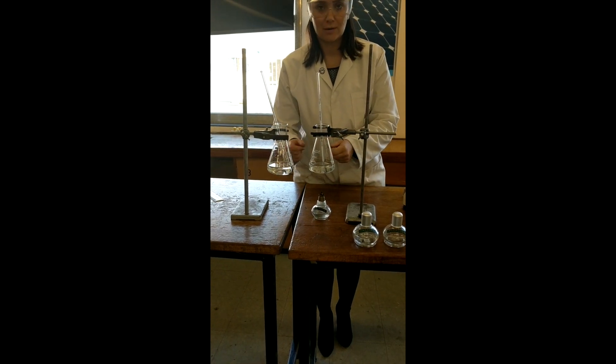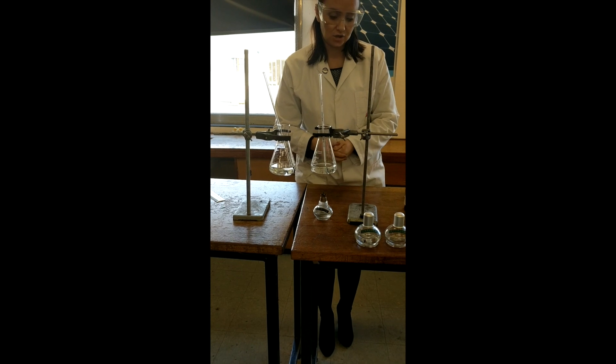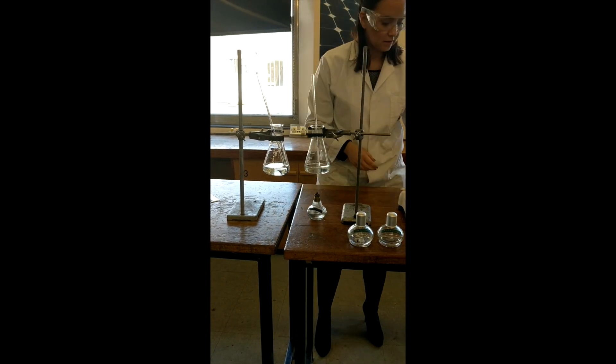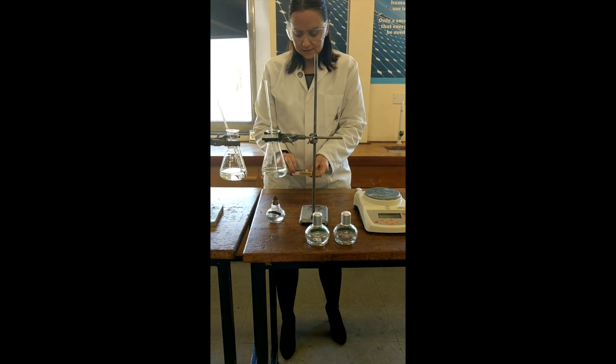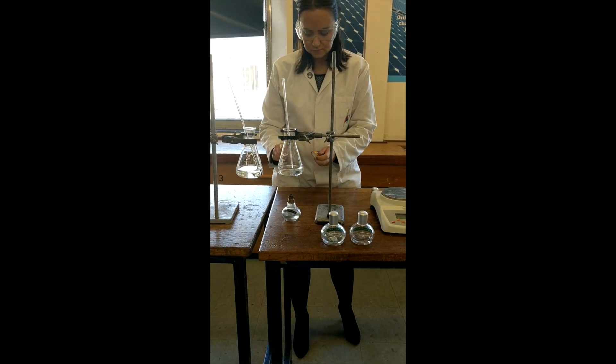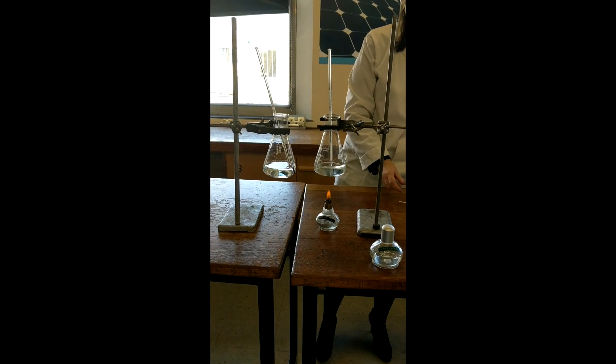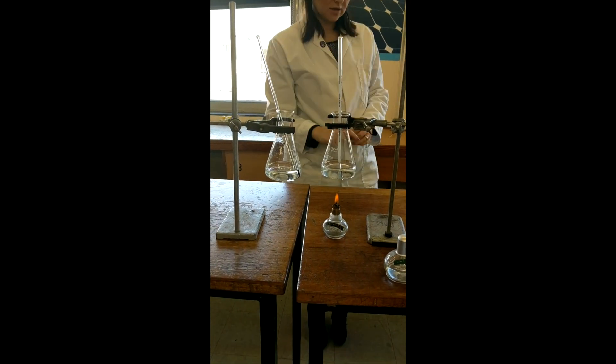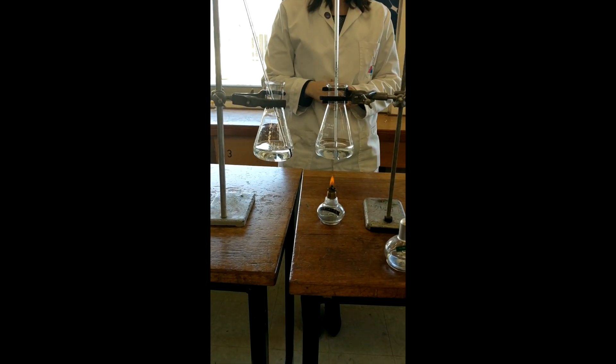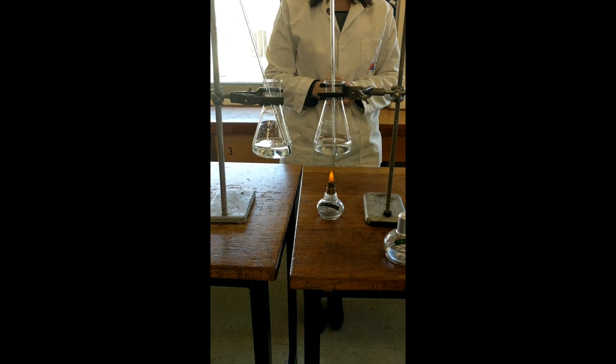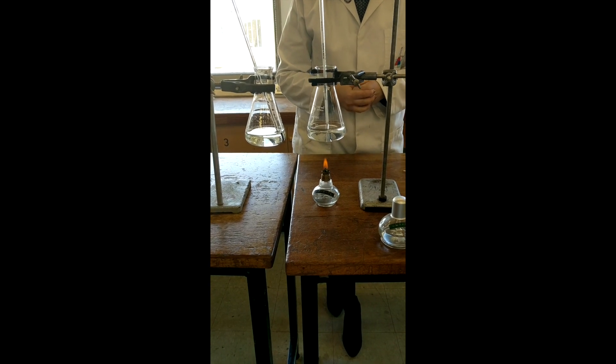And we've also got the same amount of water. It's 100 in each. So now we can set the fuel alight. And we're going to leave that in until the temperature has increased by about 40 degrees. We're looking for a 40 degree increase. It was on 21 to start with, so we're going to stop it at around 60 degrees.